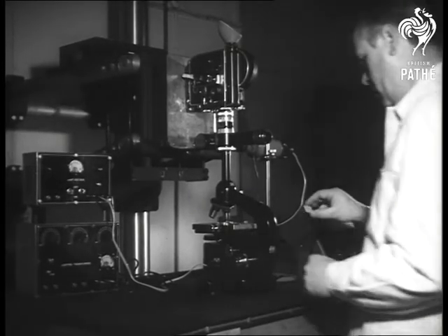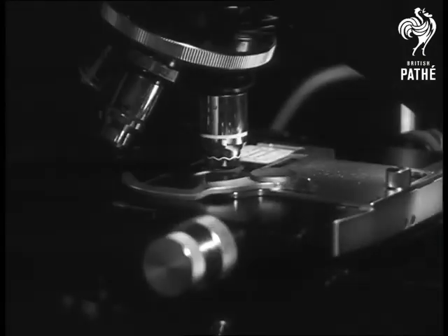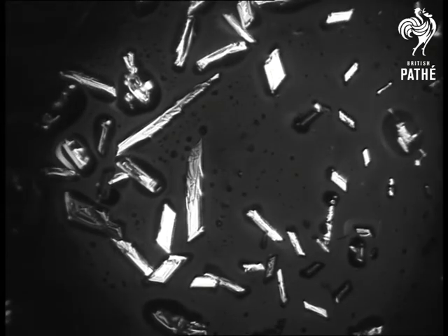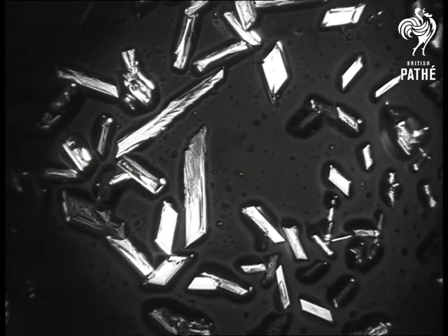The cine microscope enables scientists to take movie film. Here, the wonder of the microscope and time-lapse photography enables you to see the growth of copper sulfate crystals.